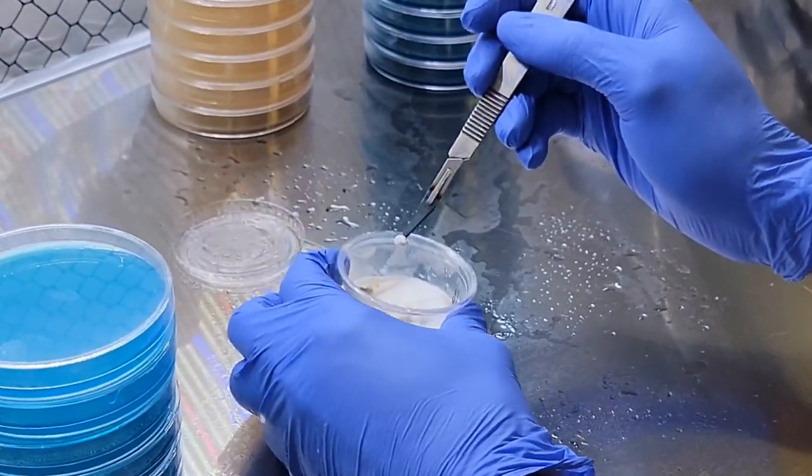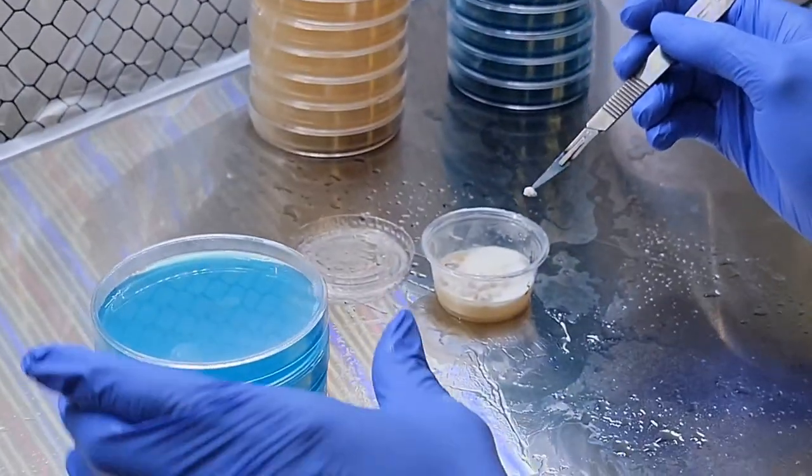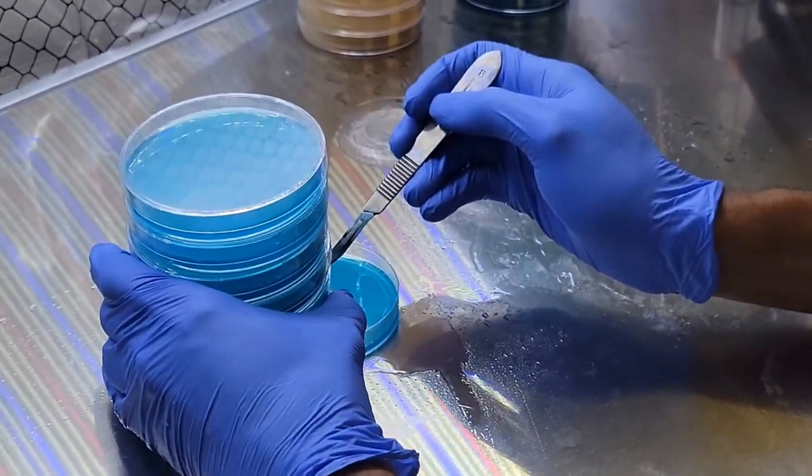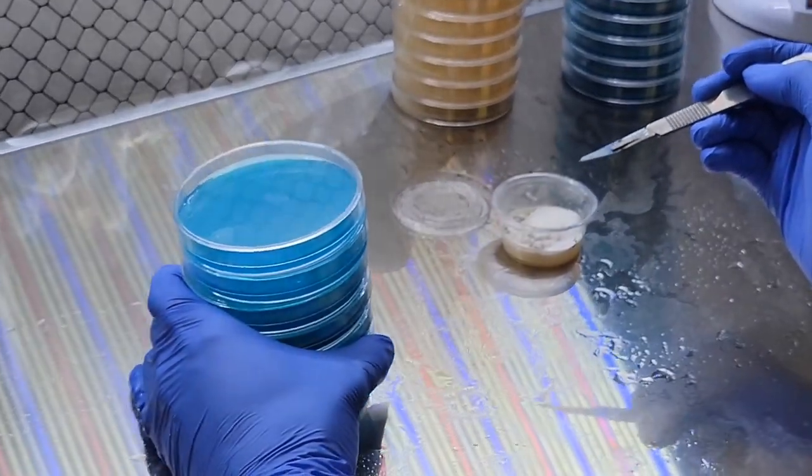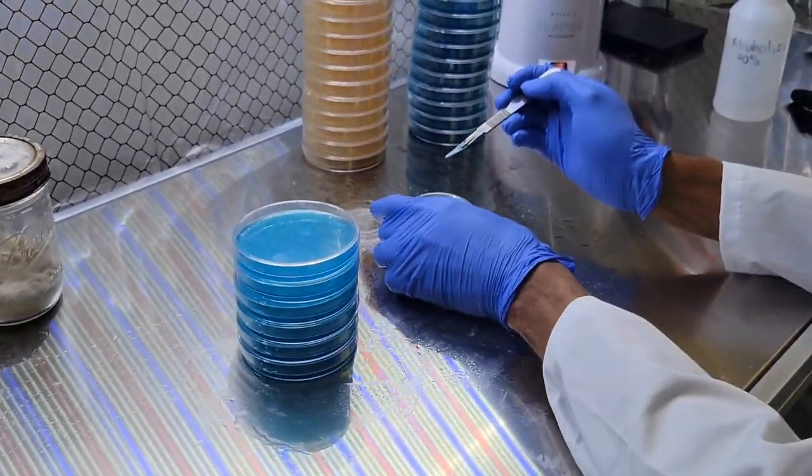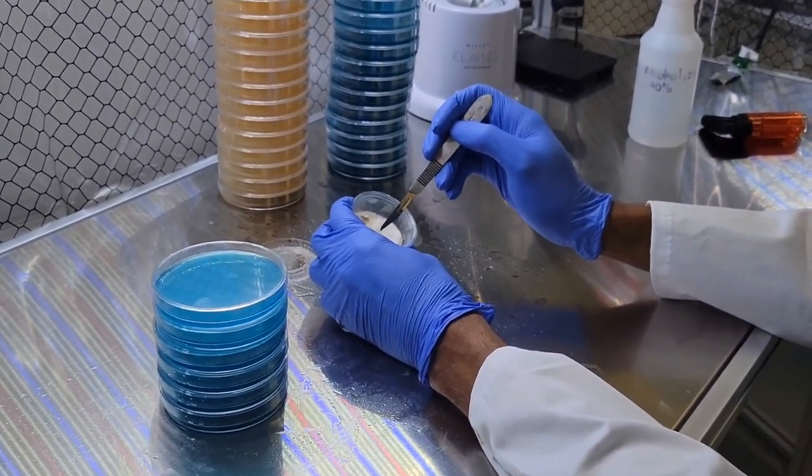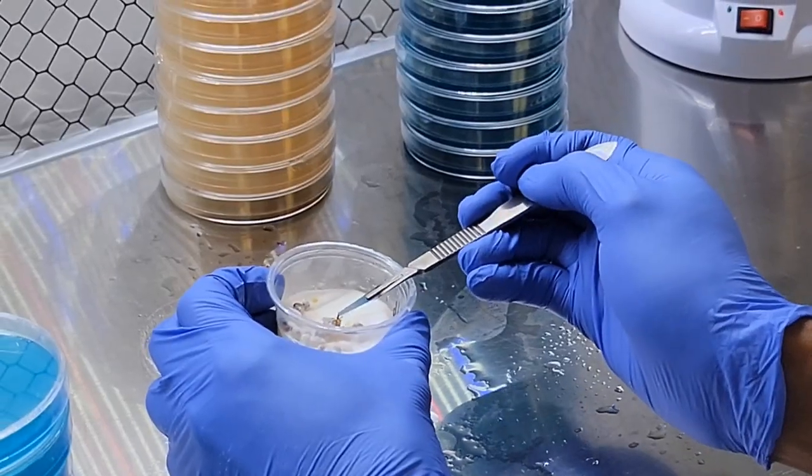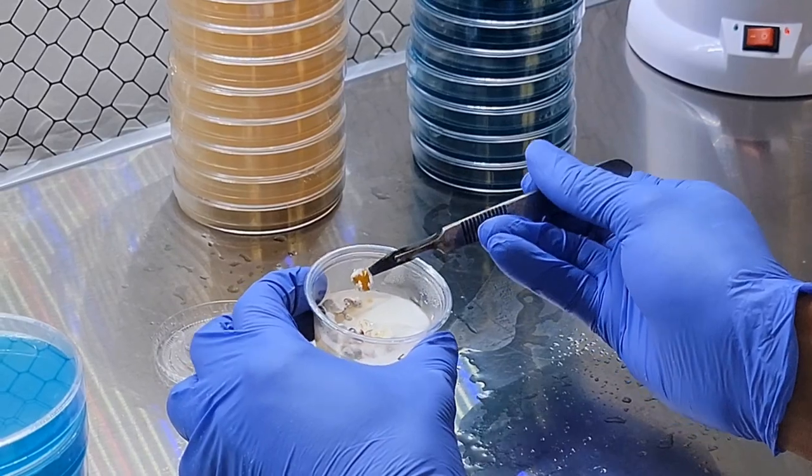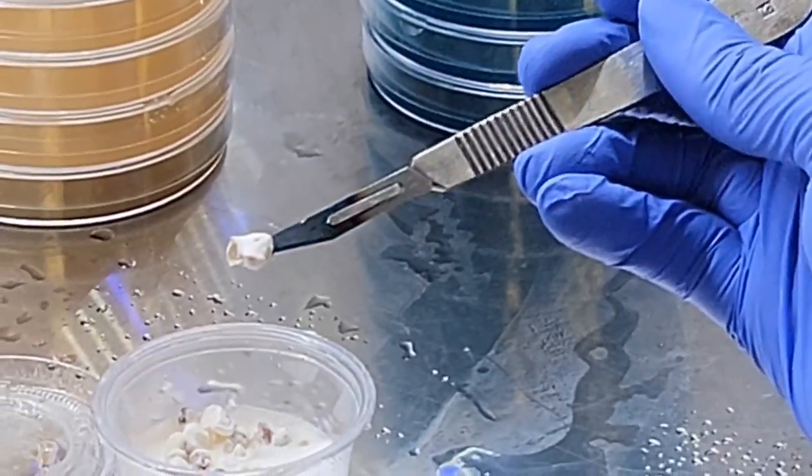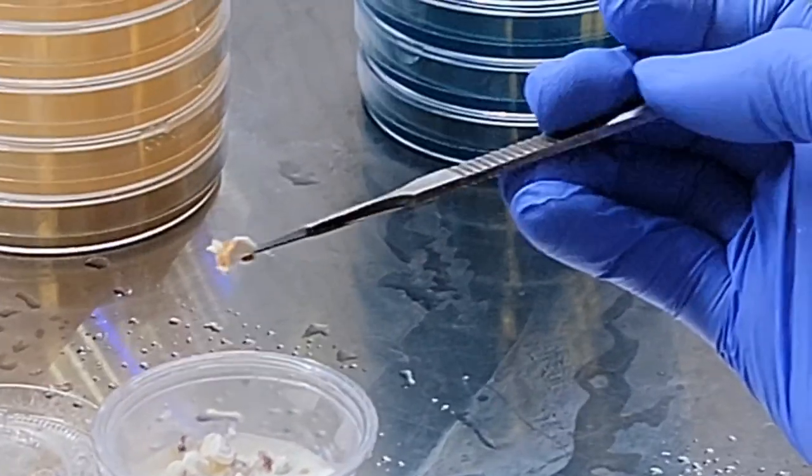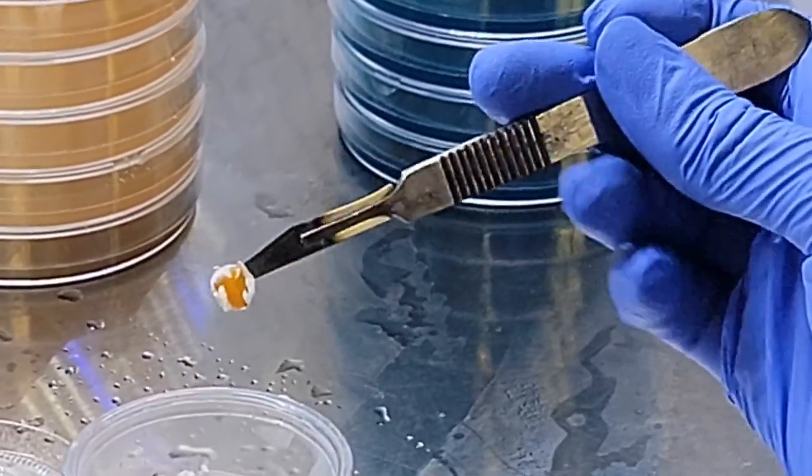And what you can do, you can just keep them going. Boom. And you can get so much from so little. This is a piece of corn. You can actually see it's corn on this side. The mycelium have coated and colonized the entire corn.